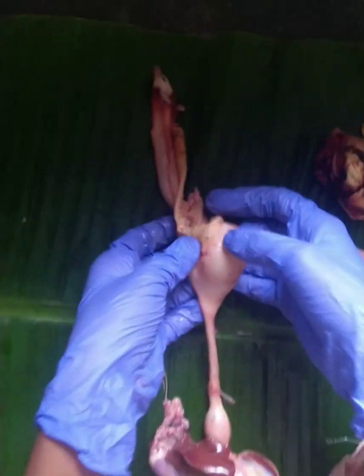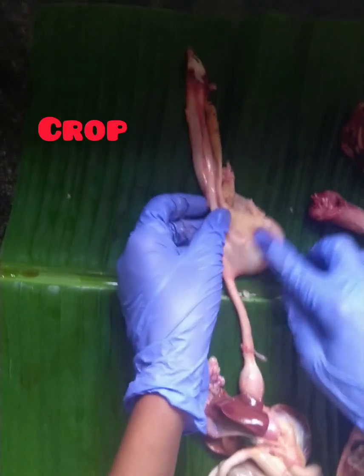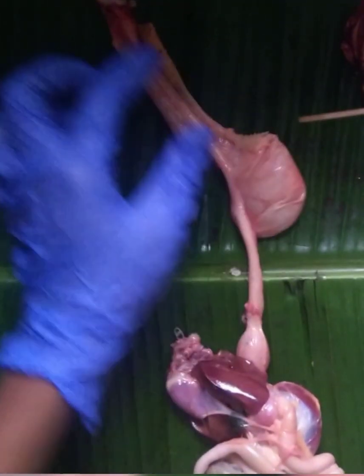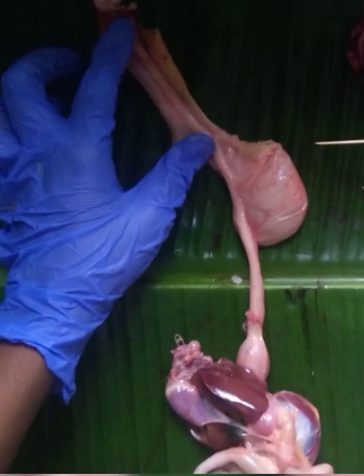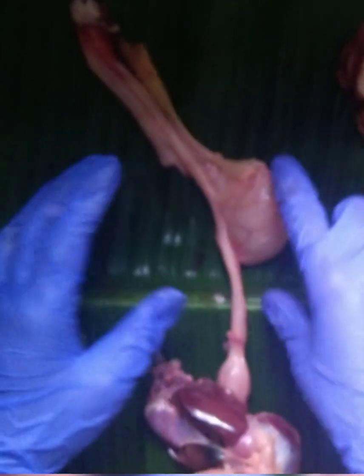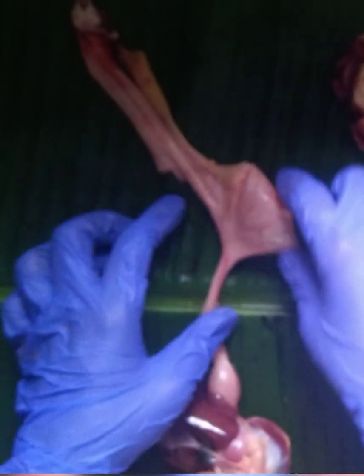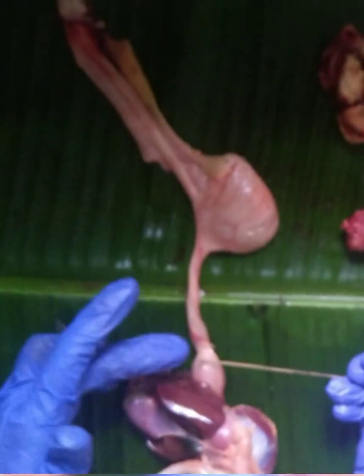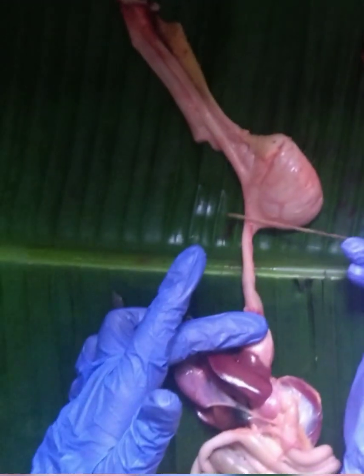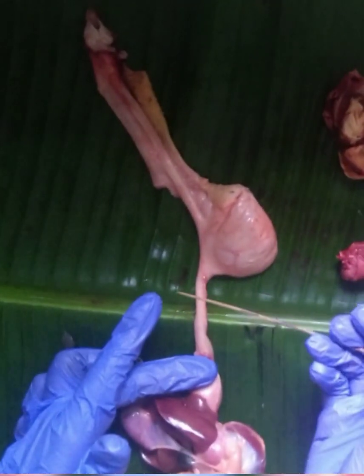This prominent part you can see here is known as the crop. The region before the crop is known as the pre-crop region, and the esophagus after the crop and before the stomach is known as the post-crop region.